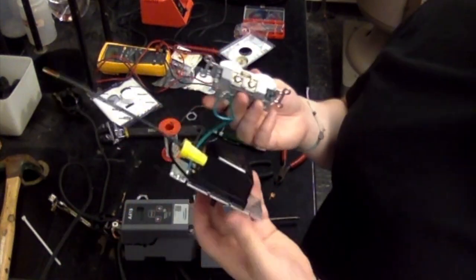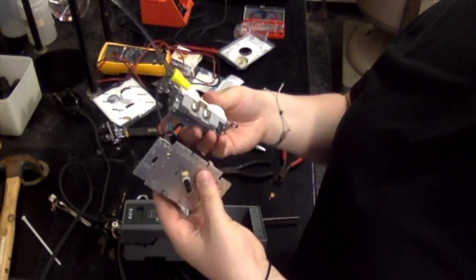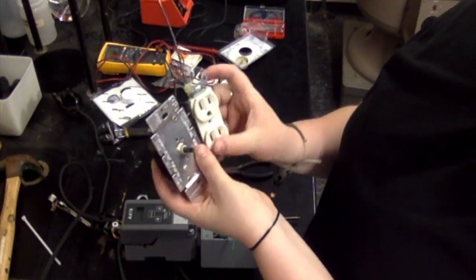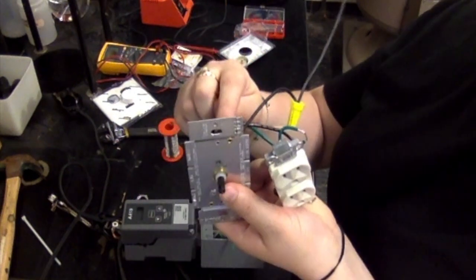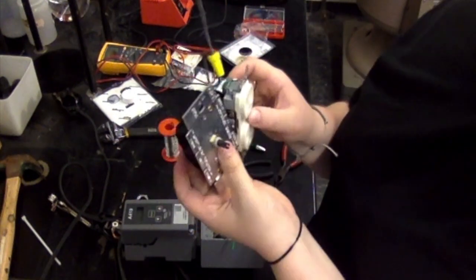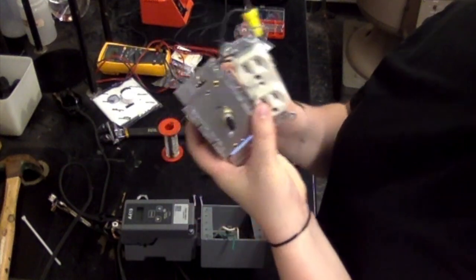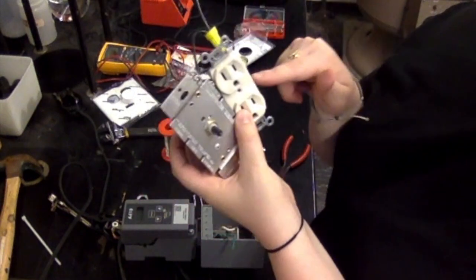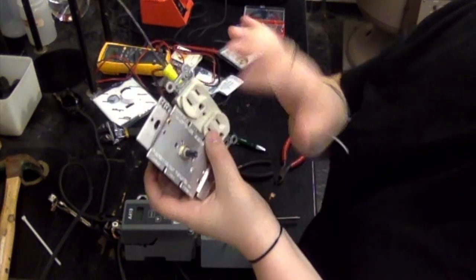You're going to want to make sure this is all oriented properly. When it's all said and done, you're going to have the 2-gang outlet on the right side of the box, and you're going to have the dimmer switch on the left, and you want the wires of the dimmer switch to be in the up orientation. It might help to get them in this order and then bring that around, and you want that wire to go behind. You don't want it to come up front, over across, because then you're not going to be able to put the plate on.